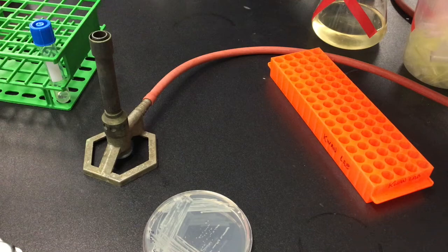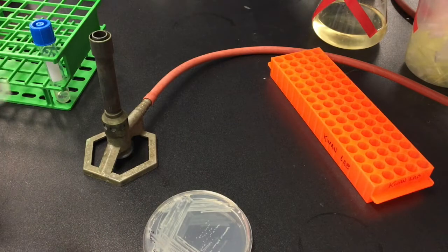Hello 515 Diploma students. In your next lab module, you will be looking at real-time RT-qPCR analysis of gene expression in E. coli. Using a tetracycline-resistant strain of E. coli, the same one you used for the PCR experiment in your lab basics module, you will examine gene expression for the bacterium when it is grown in the presence of tetracycline compared to growth without antibiotic.